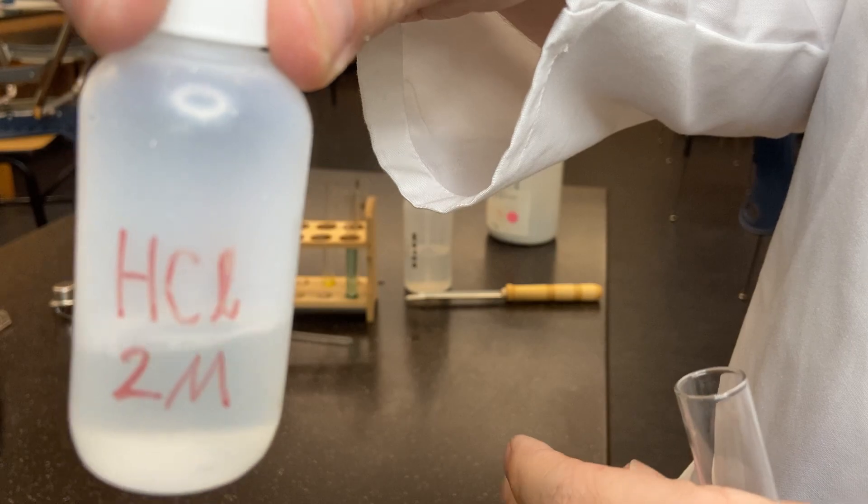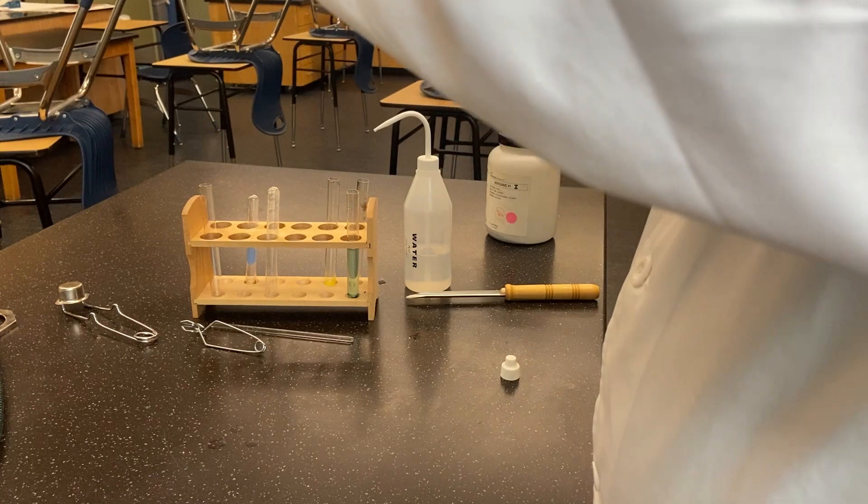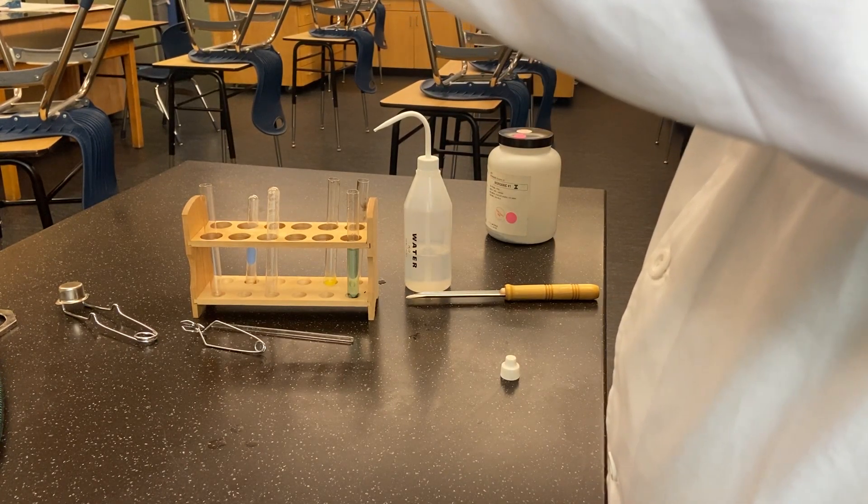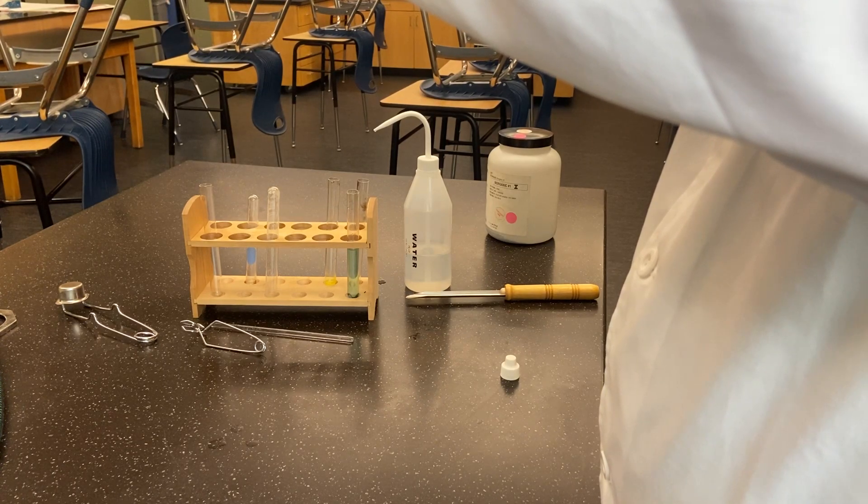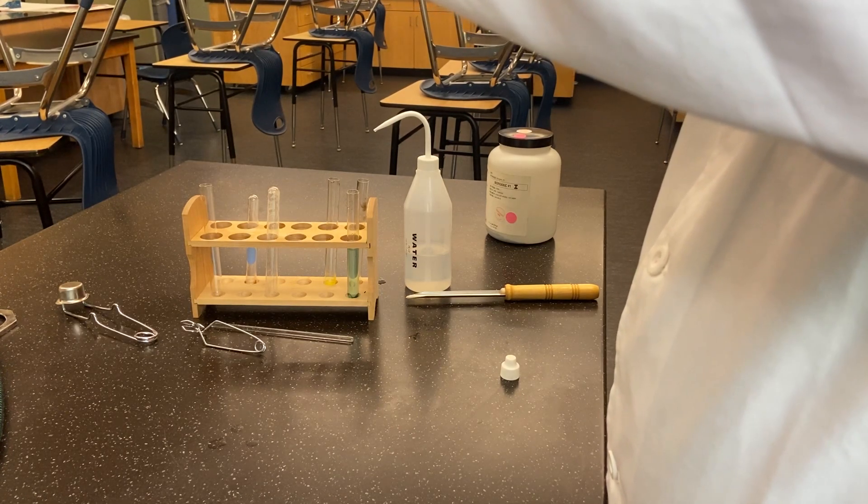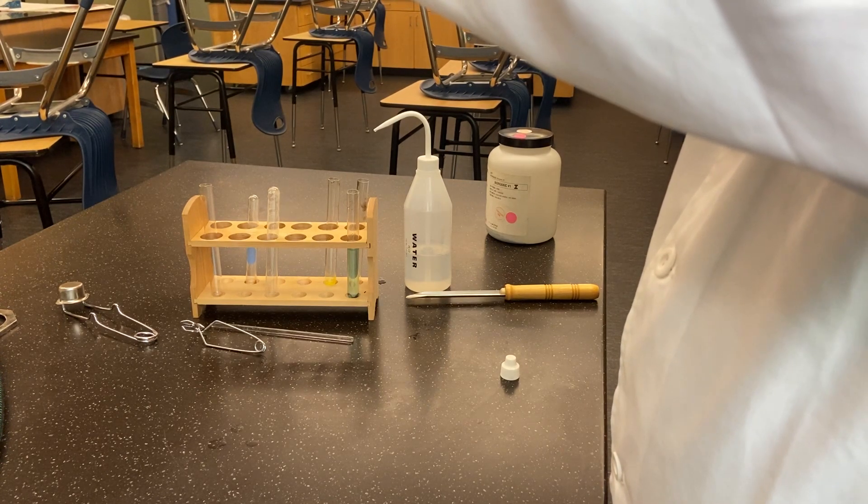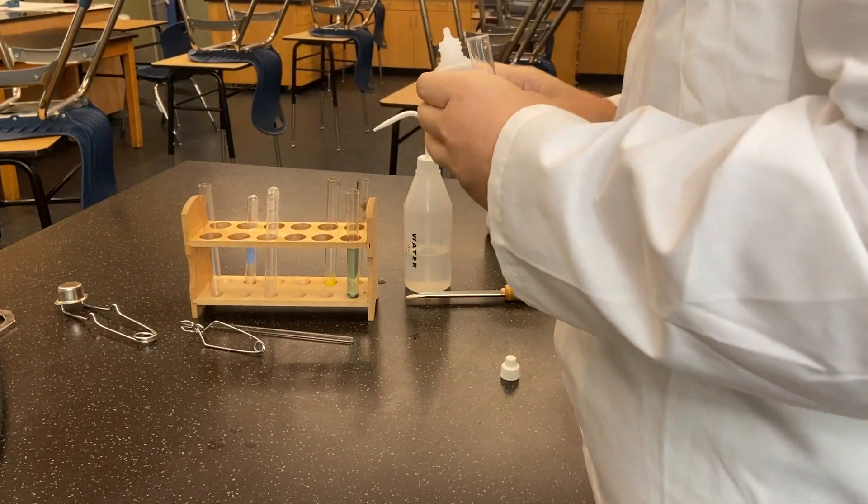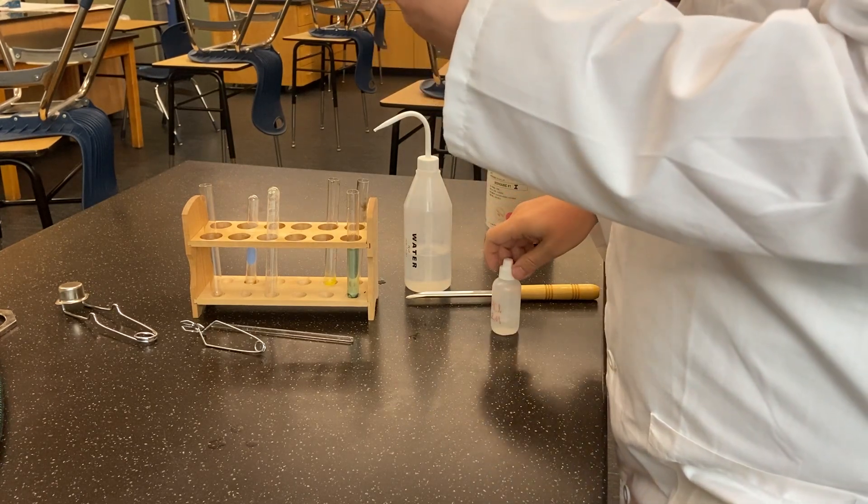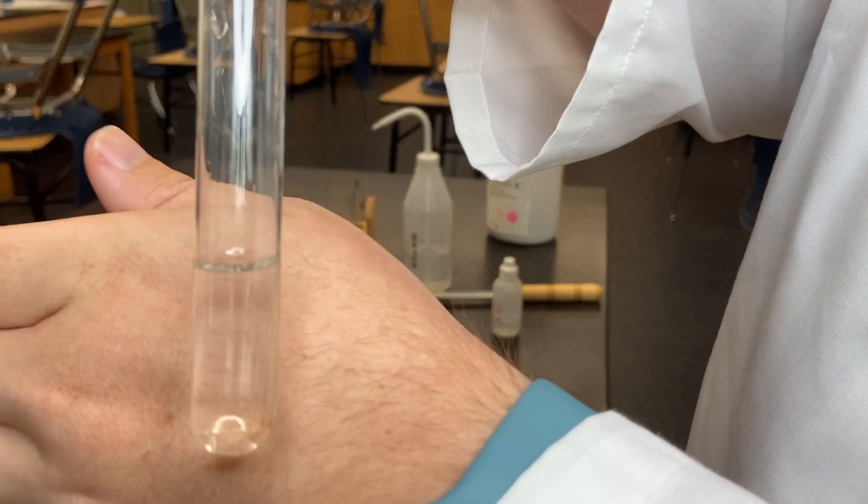We'll talk about zinc and hydrochloric acid on several occasions this year, but in this demo I'm going to take two molar hydrochloric acid and fill a test tube up about a quarter of the way. Note the color of the solution, or lack thereof.